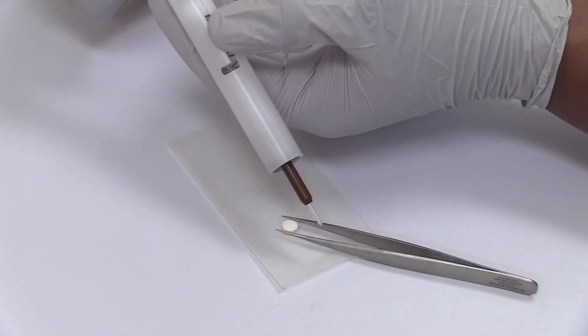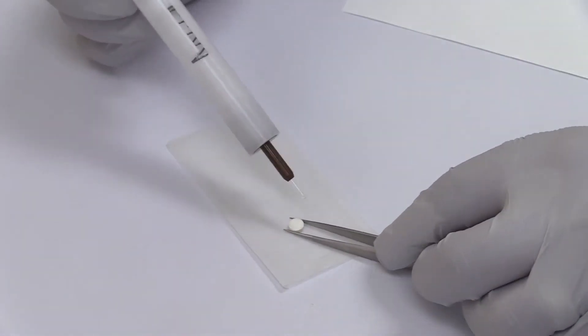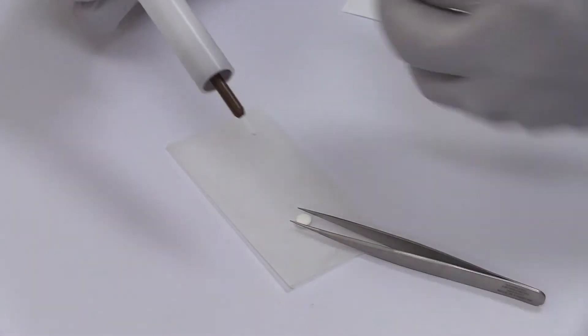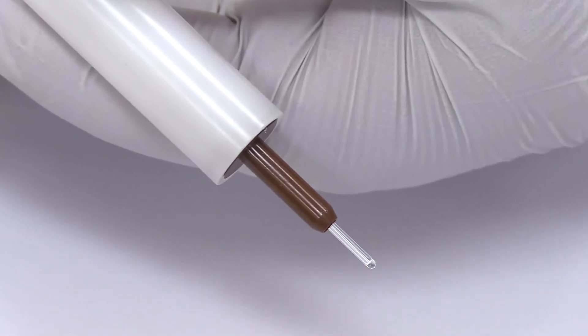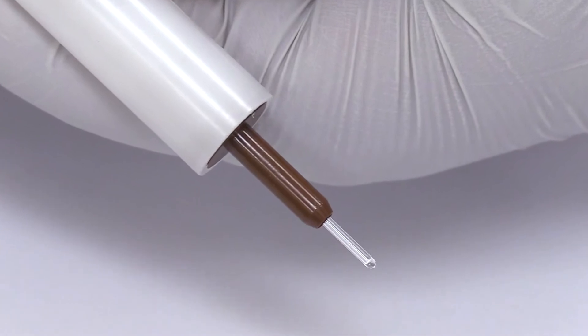First, let's extend the probe, then touch the sample and finally retract the probe. Sample handling is key and I'm careful about not overloading the probe.